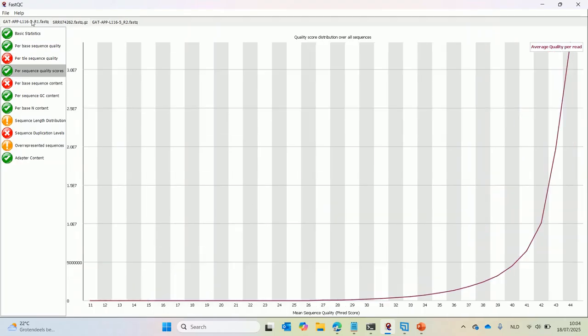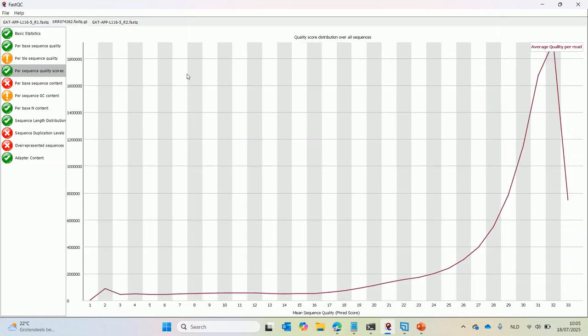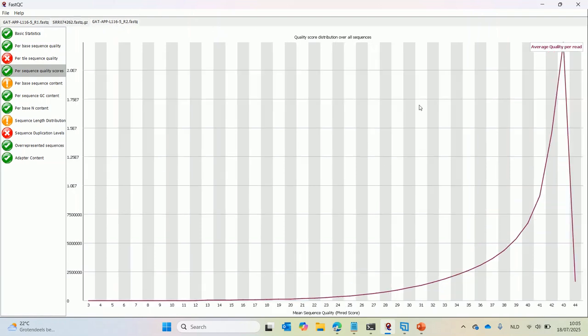When we look at the same plot for the Aviti data, we see again that the quality of the Aviti data is much higher. The peak lies at 44, which again is the maximum in FASTQC, while for the Illumina data, the peak is located at 32. When we look at the reverse reads, we again see that they are higher quality than the Illumina data, but slightly lower quality than the forward reads. So here the peak is at 43 instead of 44.